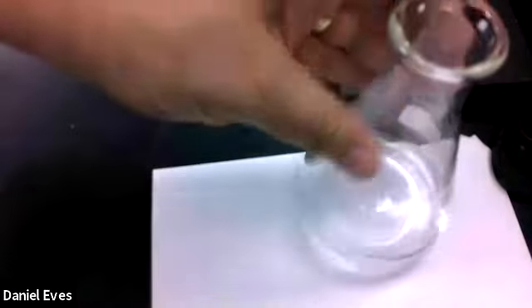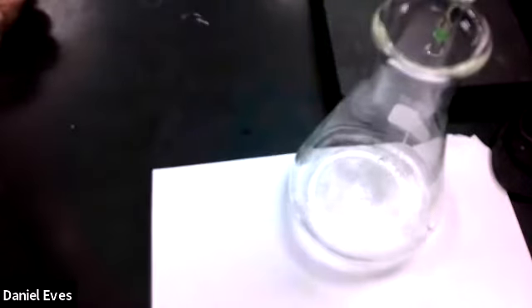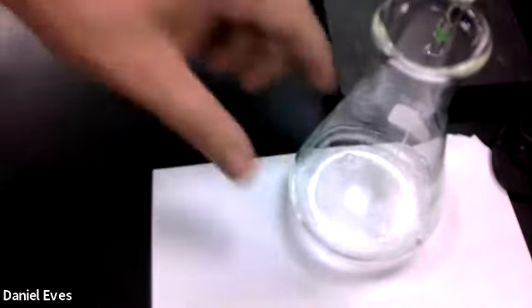Okay, so let's do a second sample, and I think we've used a little enough of this that we can use the same burette. So we're going to start off with 21.04, and we have our solution here. So we're going to go ahead and dispense ourselves. So this is the same 0.2 grams of the unknown monoprotic acid. So we're going to go ahead and add this. So again, our initial reading was 21.04.